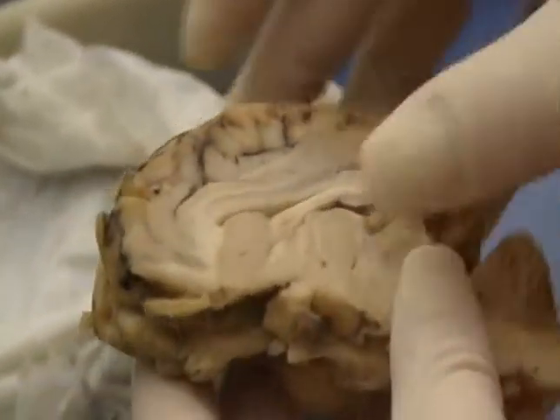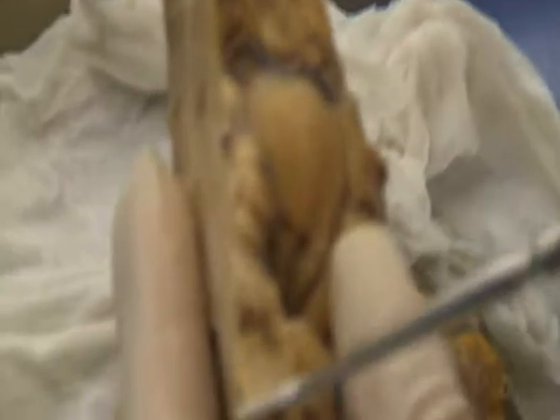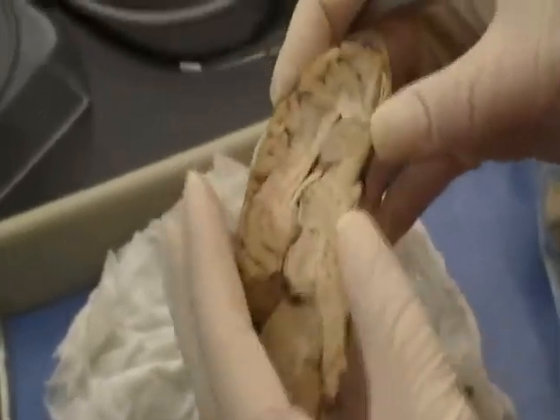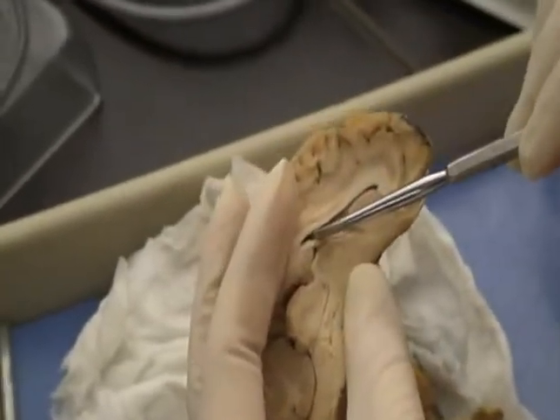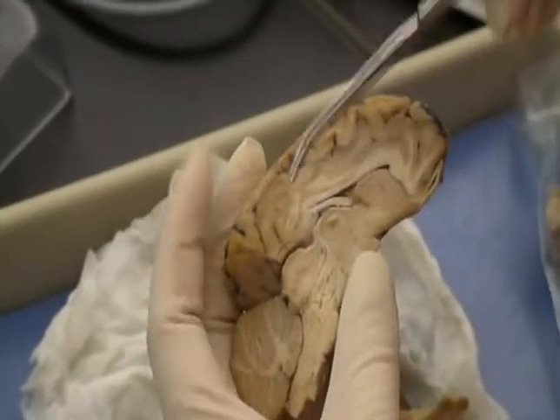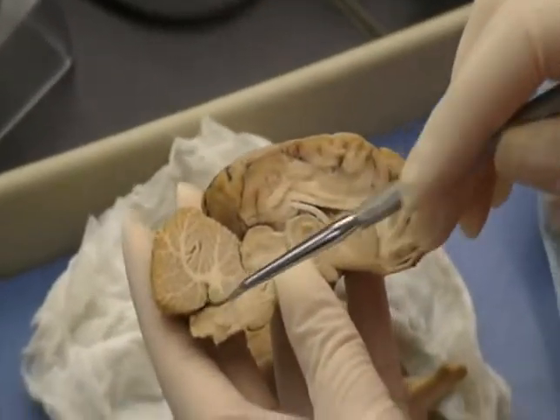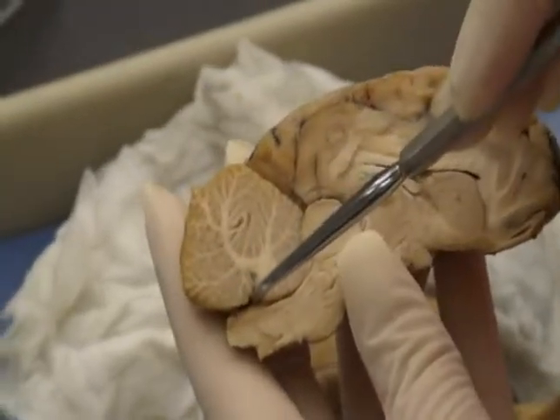Okay. The medulla is right here, everything is going down here. The ventricles, there's four of them. There's two lateral, which are inside of here. Remember, the third one, if you cut through, would be in this area here, between the two halves of the thalamus. And the fourth ventricle is down here. Remember, the cerebral aqueduct is the passageway from the third to the fourth ventricle.